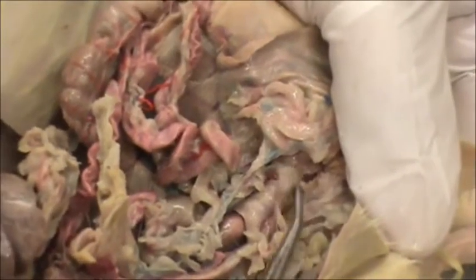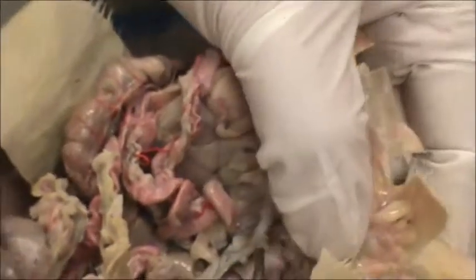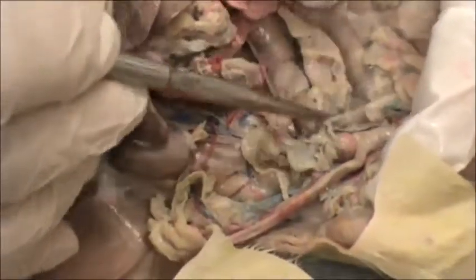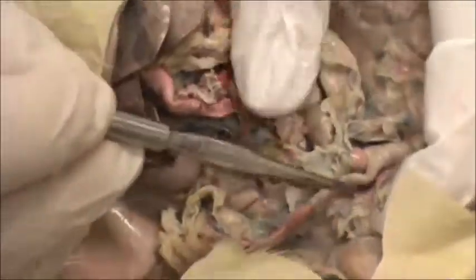In the female, behind the bladder is the vagina, and in the rat the vagina is Y-shaped. Here's the vagina, and this is the uterus, and the uterus is Y-shaped because rats have between 6 to 12 offspring and they need lots of space to put those babies, those fetuses.